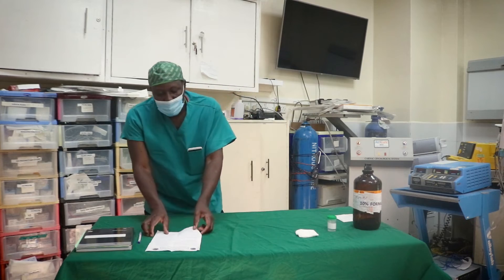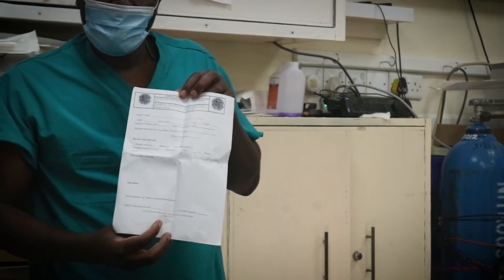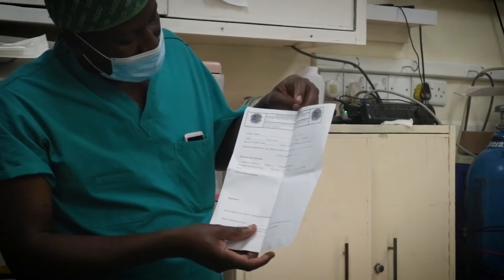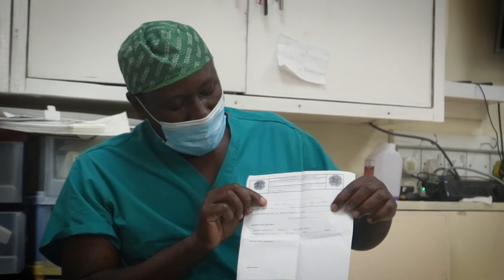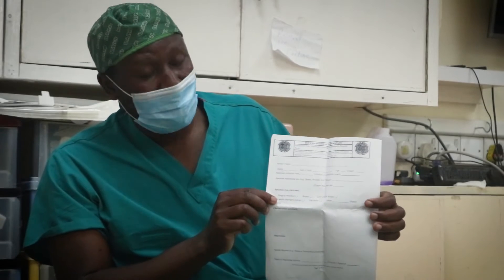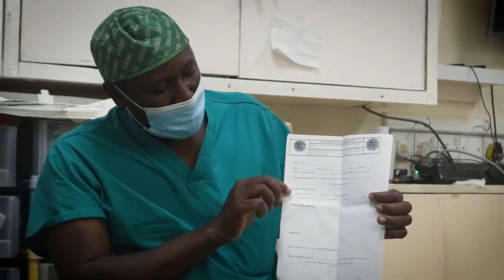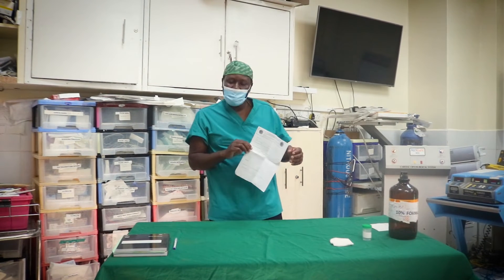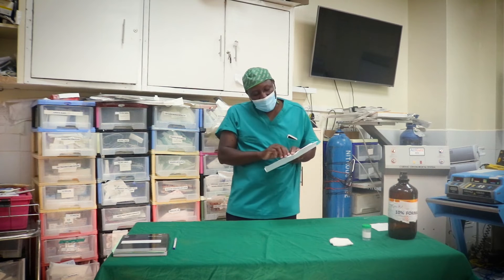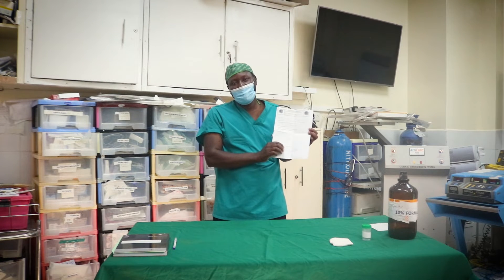After that, there is what we call a histology or pathology form. This form should be filled by the surgeon who performed the procedure. The form contains the name of the patient, hospital number, date, age, gender, the type of tissue removed, and the method by which the tissue was removed — whether through a needle extraction, excision, or incision. The surgeon will fill in the patient's details and history on this form, and the form should be signed.